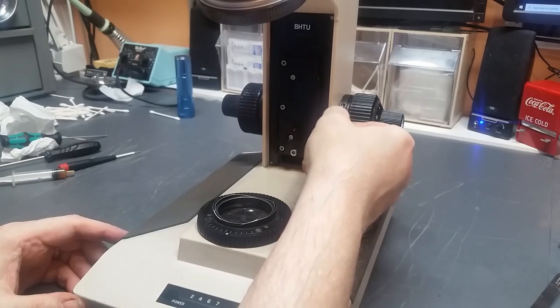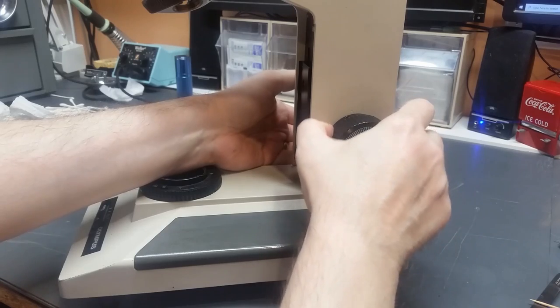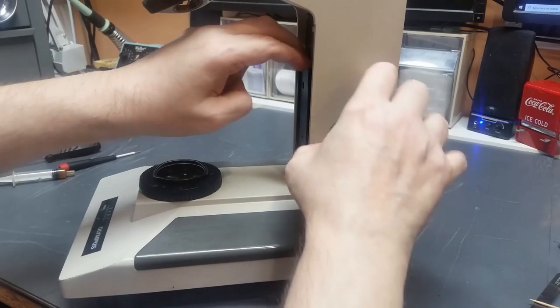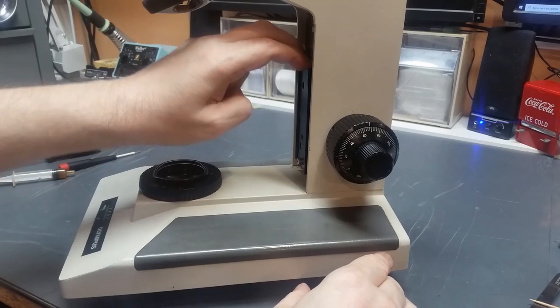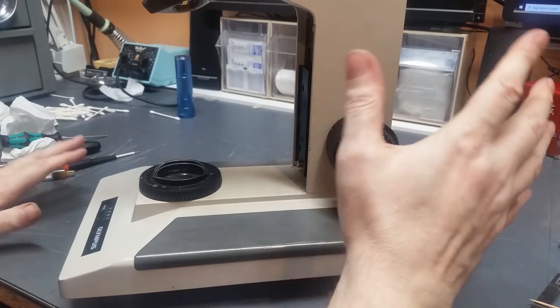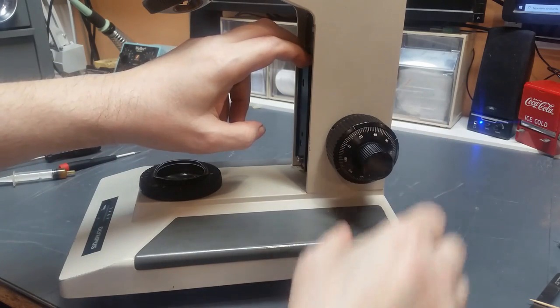This ring here is a tension adjustment knob, and it's what firms up that adjustment. And we want to turn that thing clockwise until this thing starts to firm up. And what you want to do is adjust that so that when the weight of your stage is on there, it doesn't backdrive. As you can see now, it's not. If I loosen it, it will. So what you'd like to do is tighten it up so that with the stage on there, there's enough tension so that it doesn't backdrive and it doesn't lose focus. Otherwise, your focus will creep out of focus. And you don't want to go too far with that because that just makes this thing needlessly stiff. So right now, I'm happy with where it's at. I think it'll be fine, but once the substage and stage and everything is installed on there, then I can do some final tweaks here to make sure that it's good.